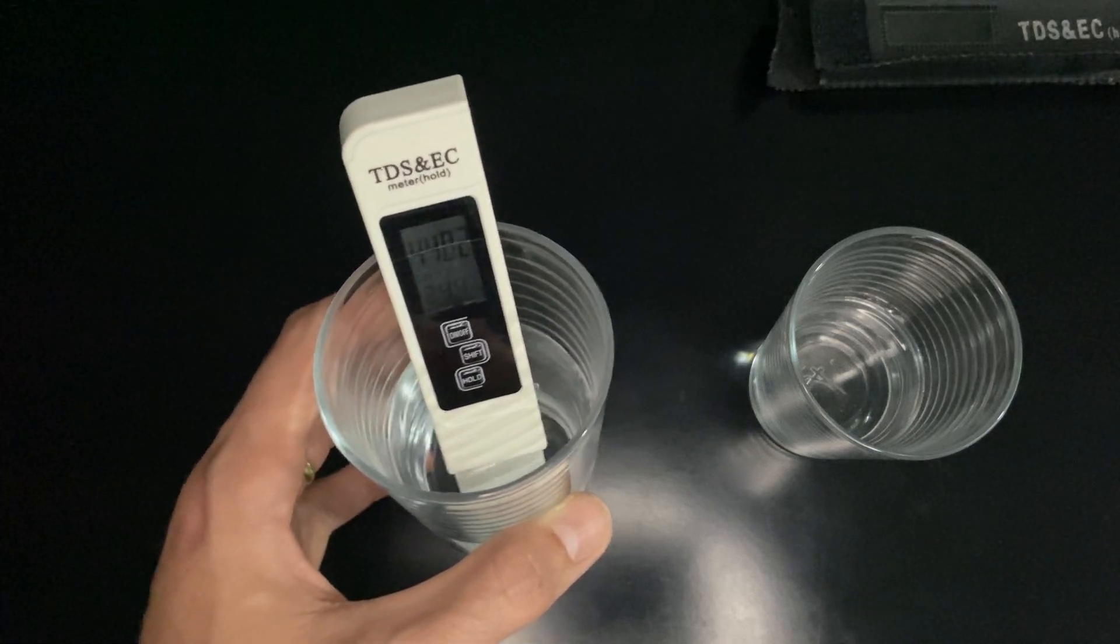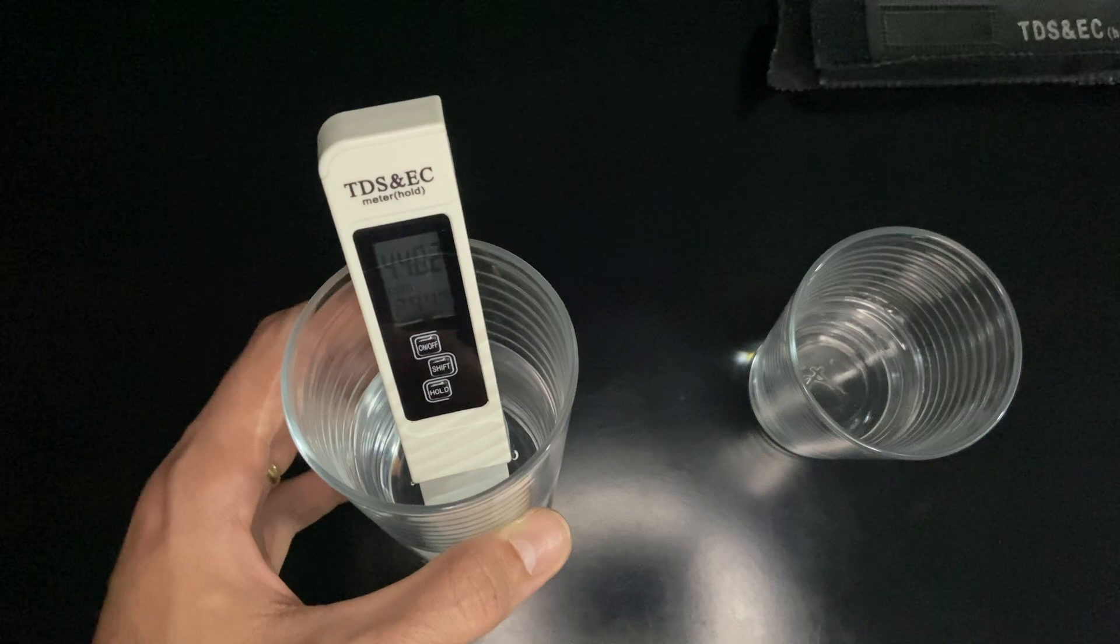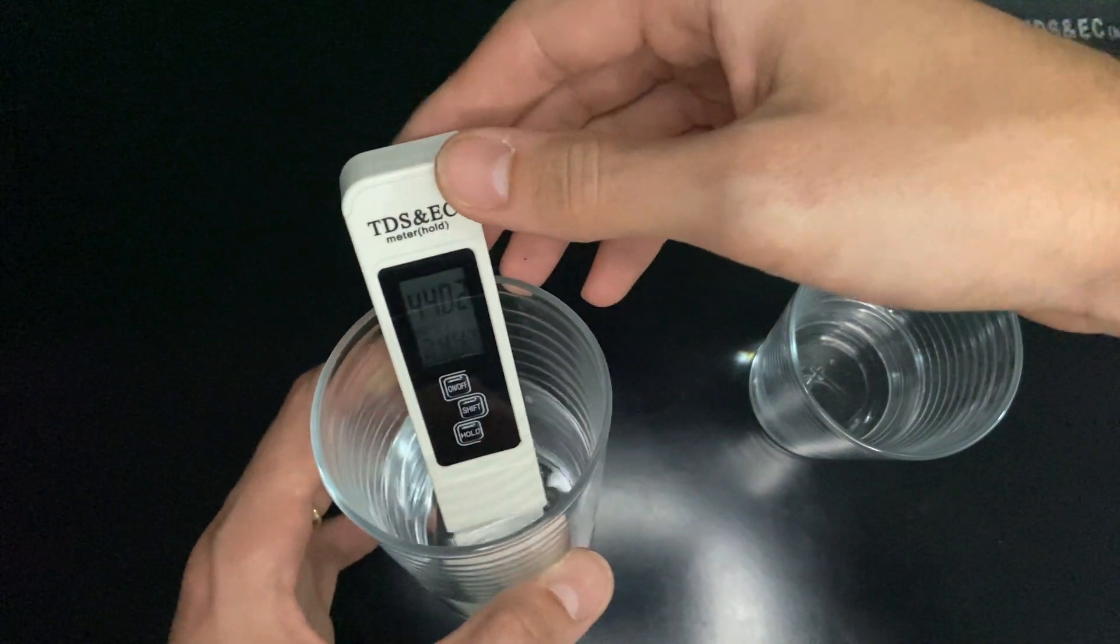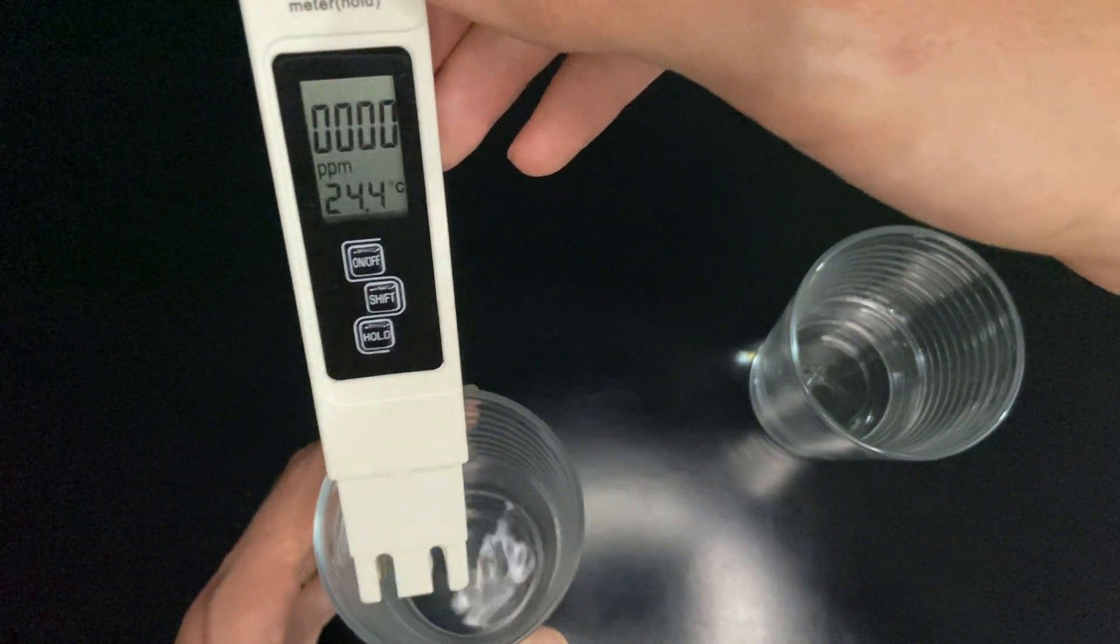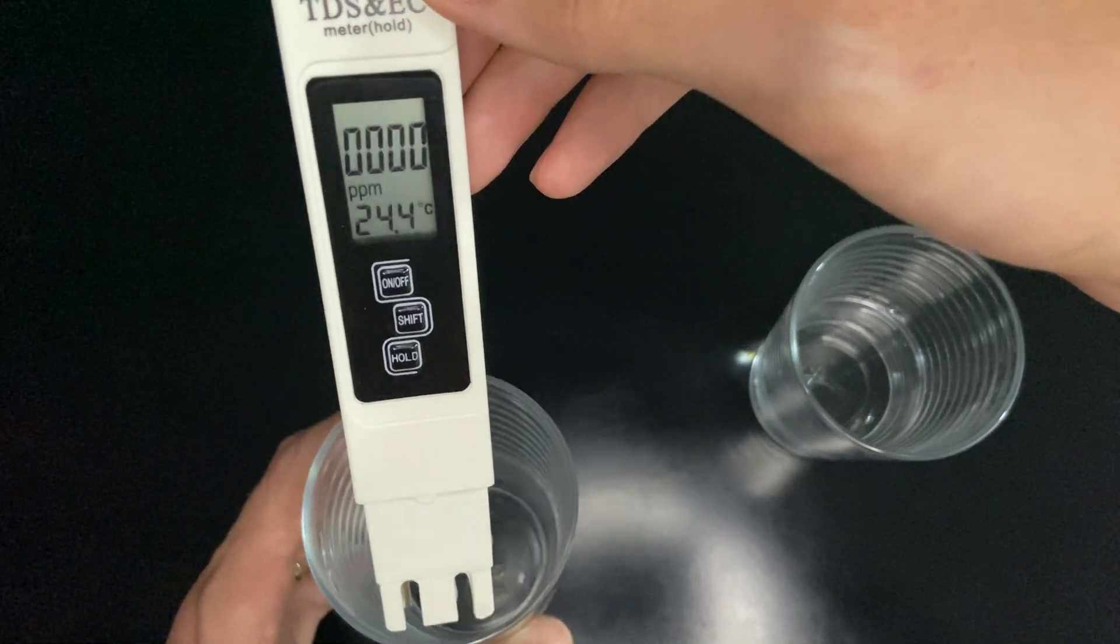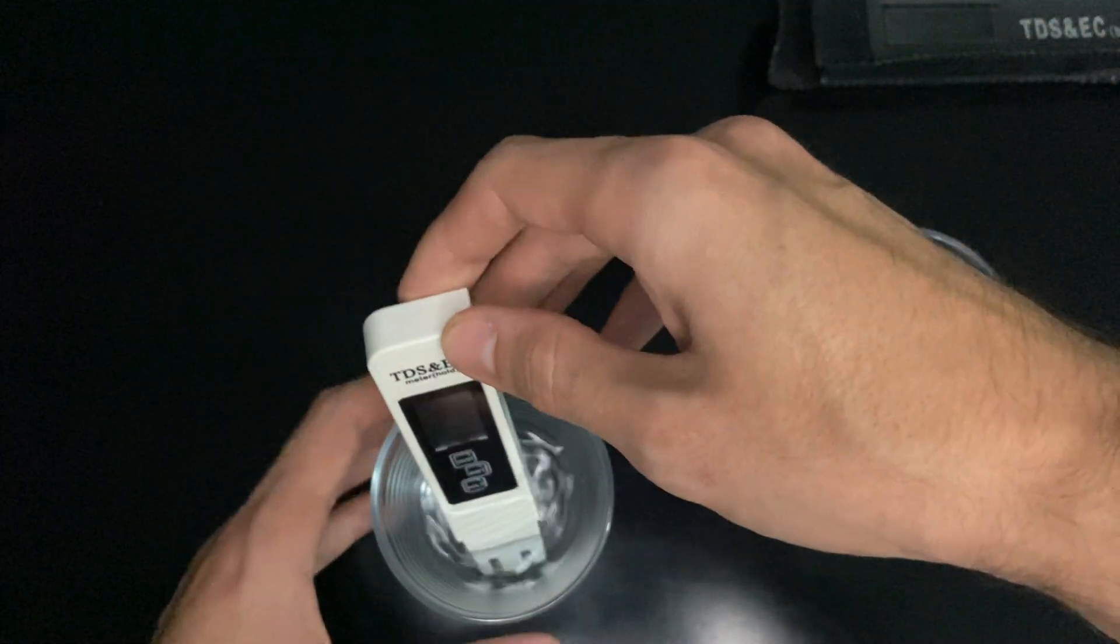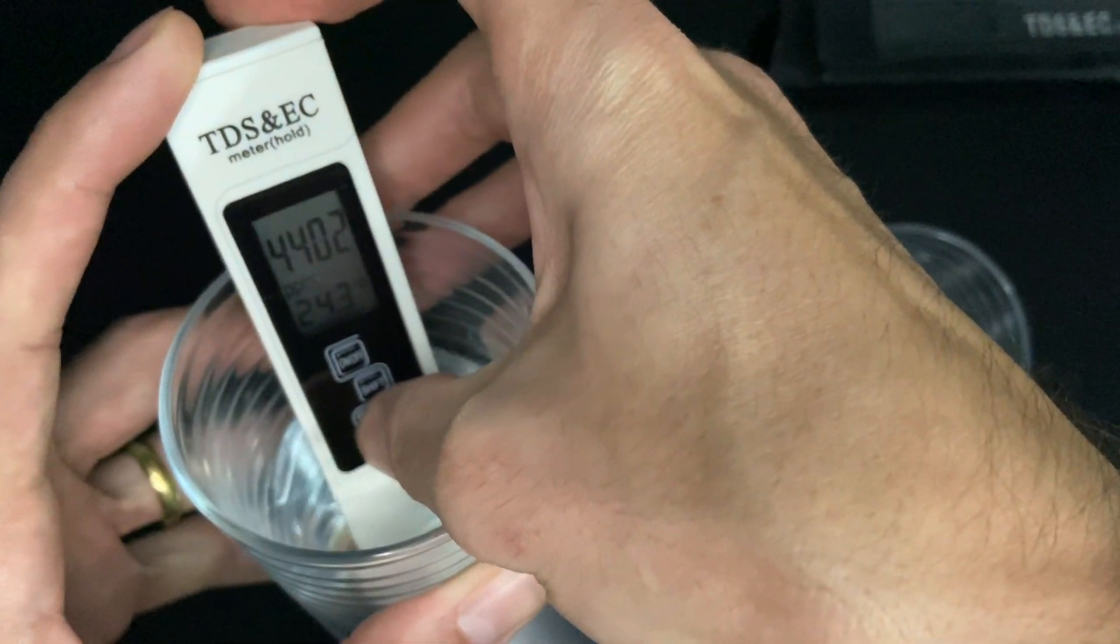Of course, if you drink this water, it will not be helpful for you. We also have a hold button. When you take the instrument out of the water, the number goes to zero. When you push the hold button here, it holds the numbers on the screen.